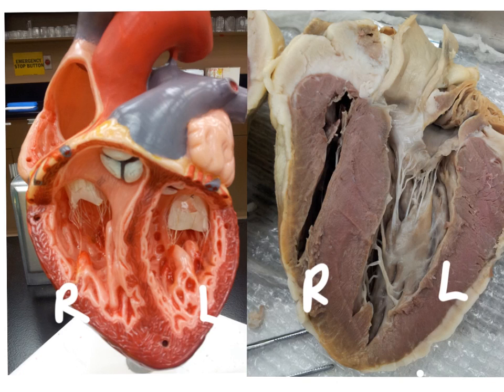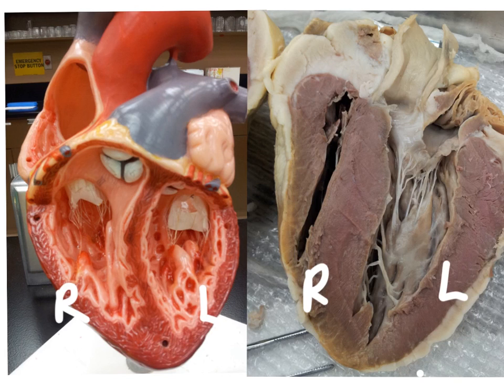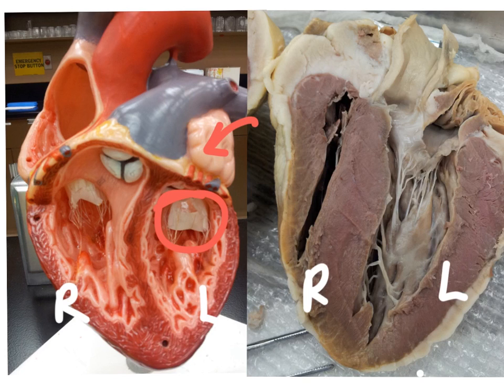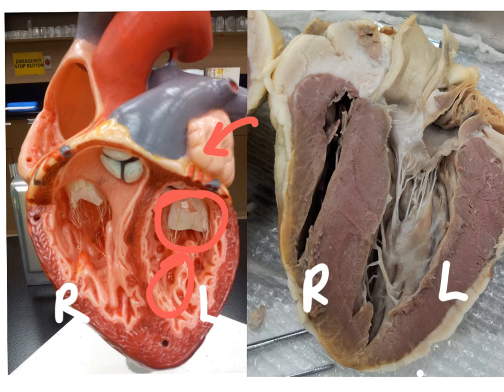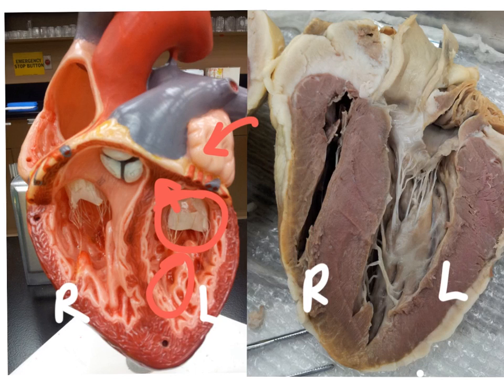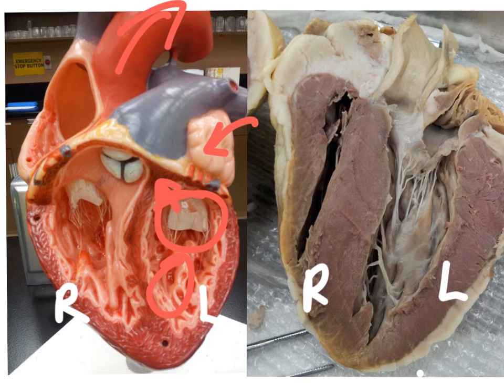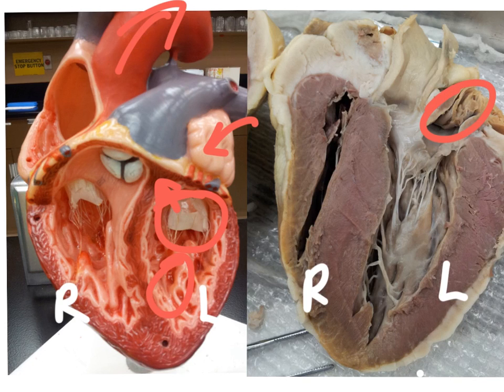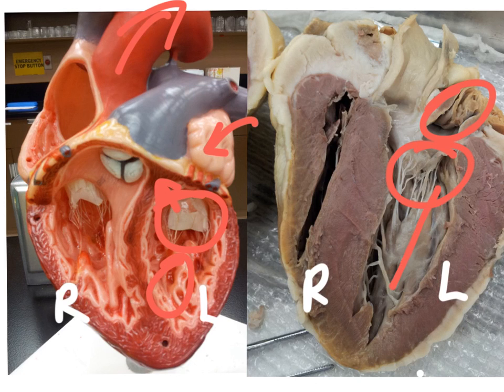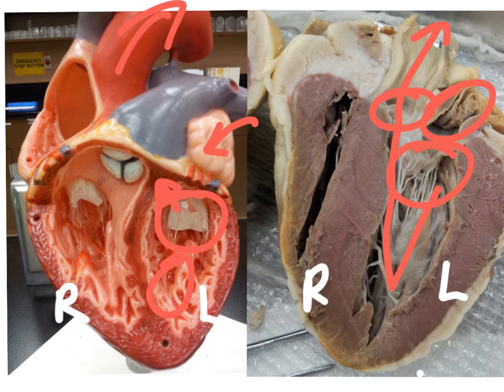Let's follow the path that the oxygenated blood takes coming back to the heart from the lungs. We're not seeing the pulmonary veins in this particular view, however they would be coming in here to the left atria, going through the bicuspid or the mitral valve into the left ventricle. They then go up and out — there would be the aortic semilunar valve and then out the aorta. On the sheep heart, it would be coming in the pulmonary veins into the left atria. There's a nice clear view of the bicuspid or mitral valve, and you can slightly see the semilunar valve leading to the aorta.